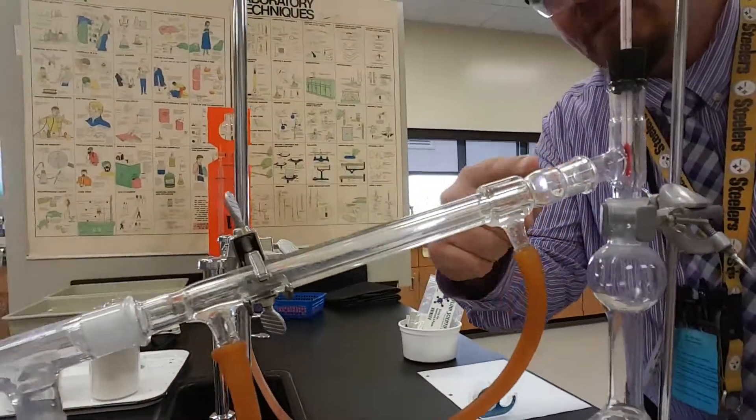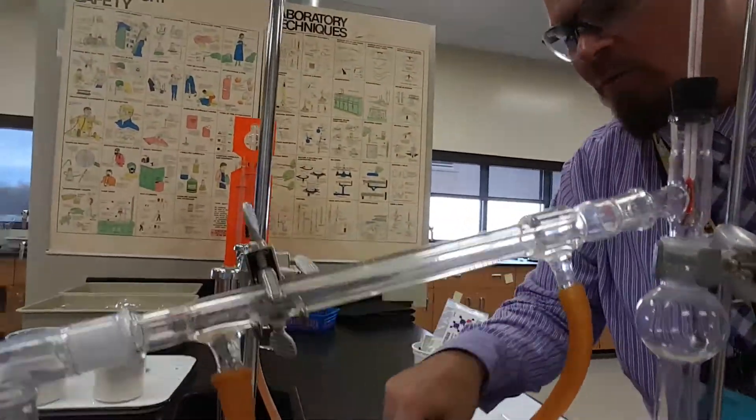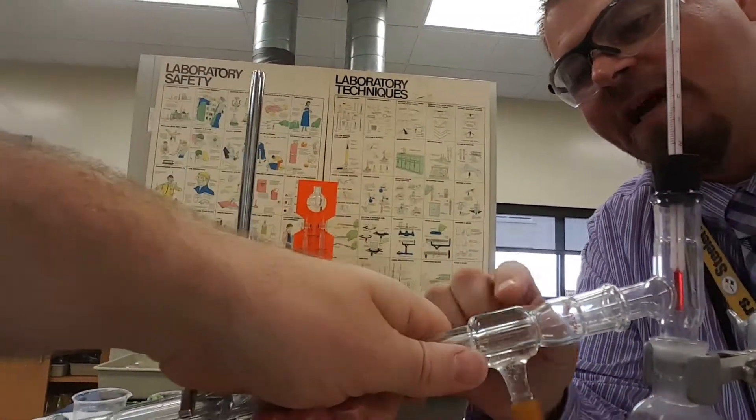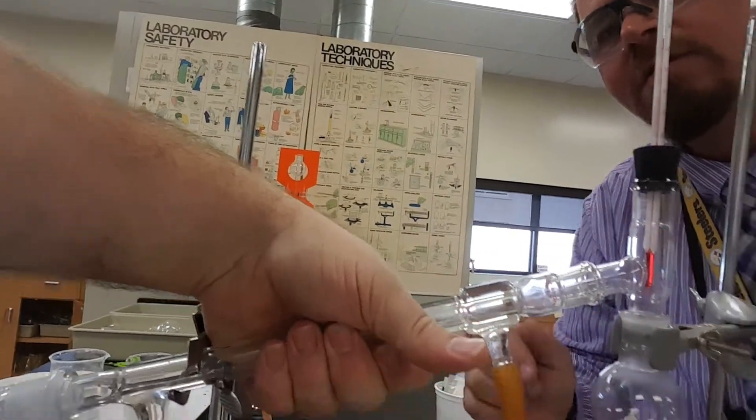What's this thing, John? This is a condensing tube. We got cold water coming up around. It's tough to see now that it's already running, but there's cold water on the outside of an inside glass tube. It's nice and cold.